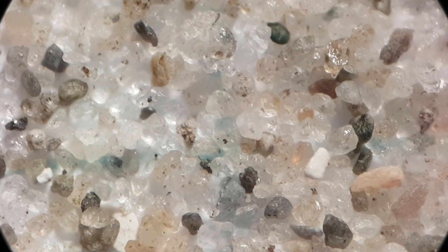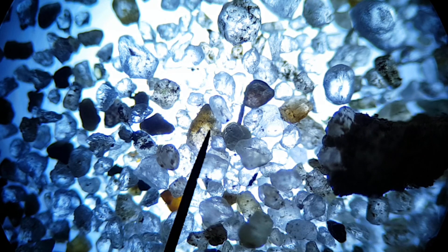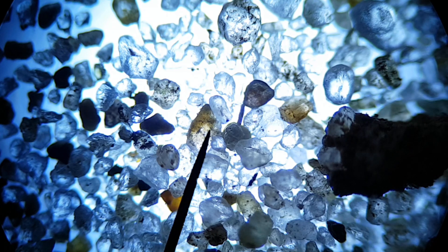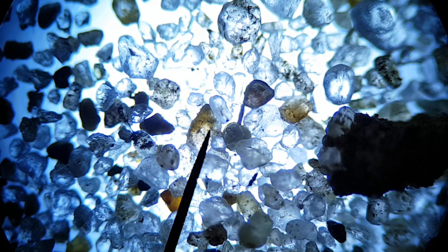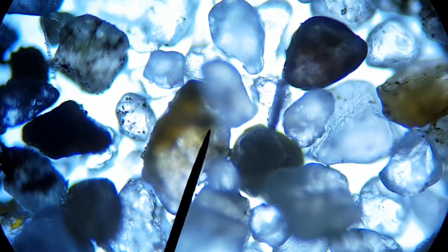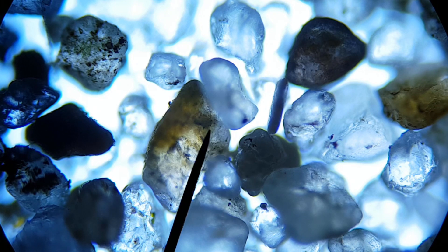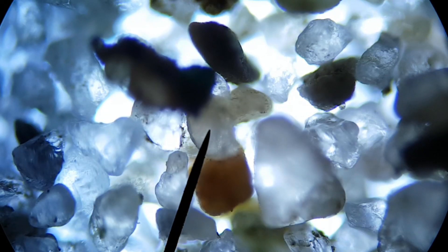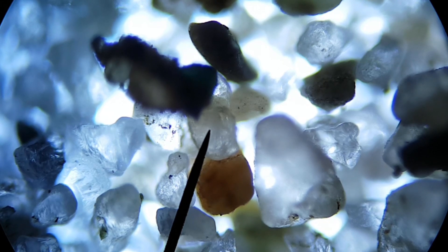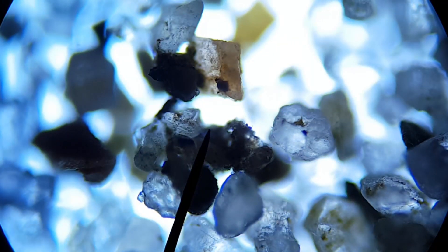Let's look at this under the compound microscope as well so we can get a higher magnification. Here's the sand under the compound microscope — it's backlit here, not top-lit as with the stereo microscope. At higher magnification you do actually see some more interesting patterns on the grains of sand themselves — like algae, dirt, or maybe minerals within the rock itself. I do think this is somewhat interesting.